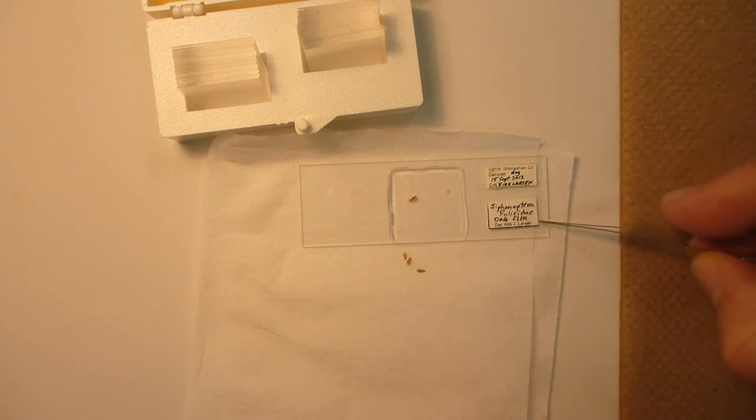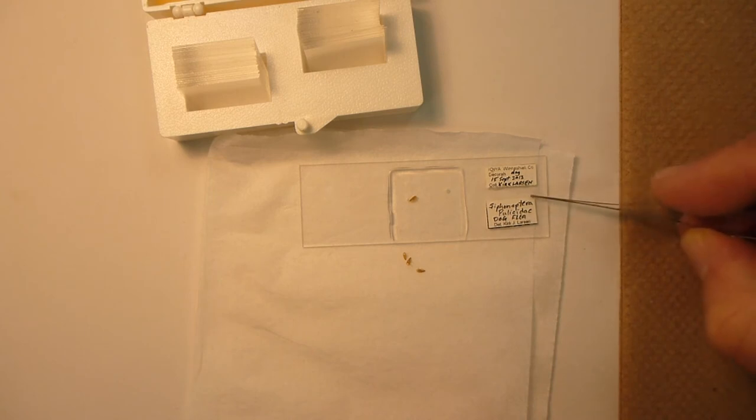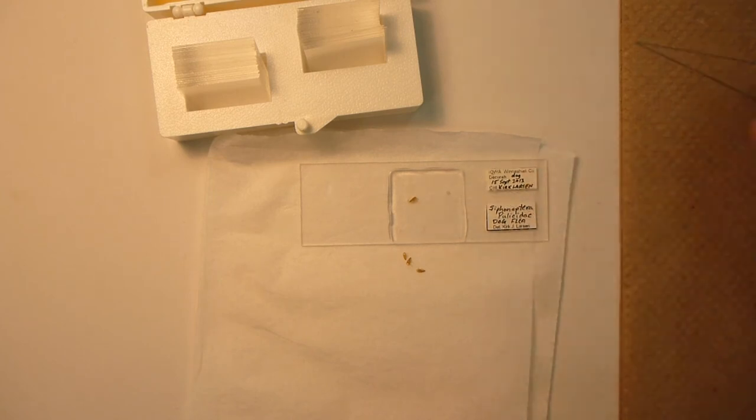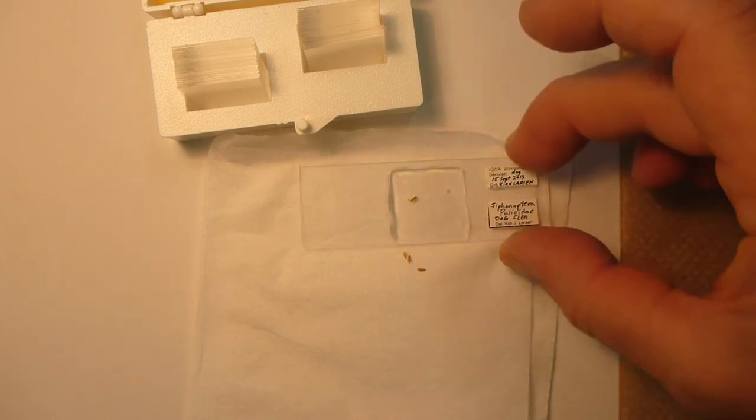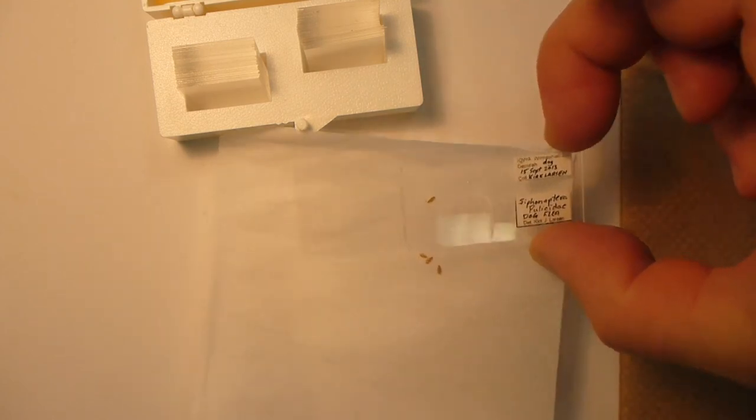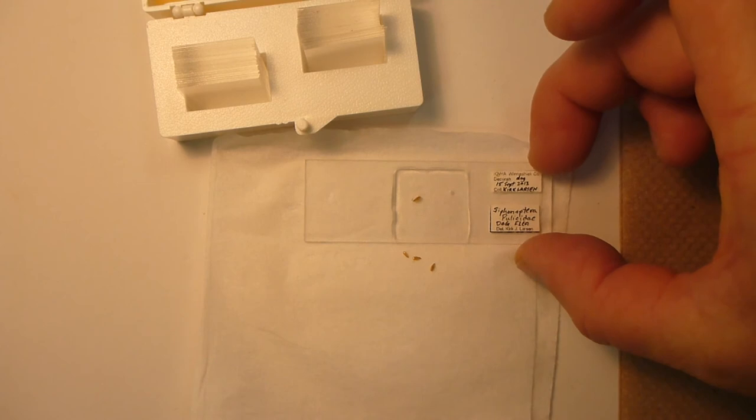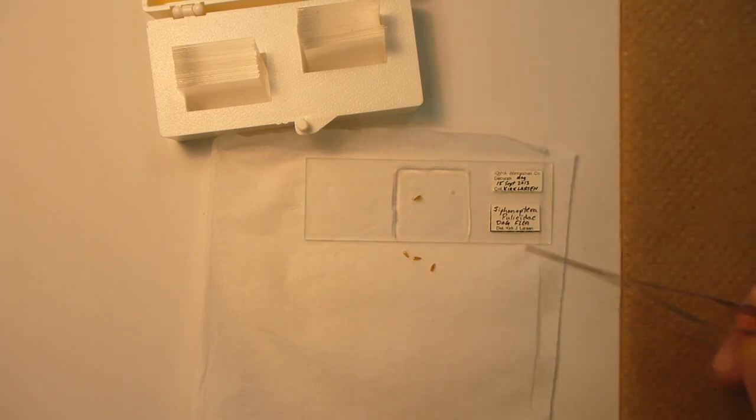And now we've got a slide with a locality label and a determination label glued onto the slide, as well as the specimen located on the slide. And then we'll be able to attach this slide directly into the specimens, or directly into the collection.